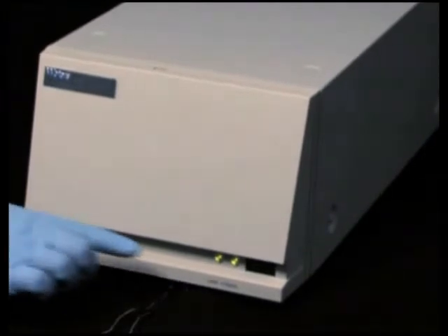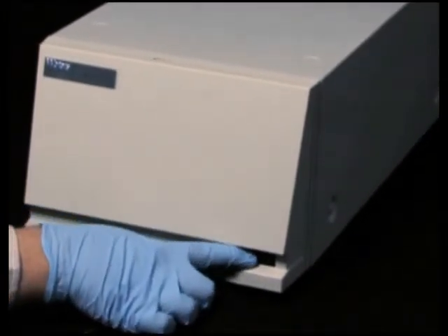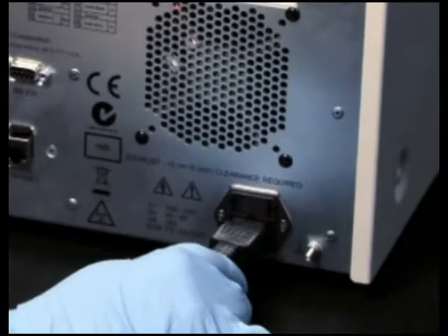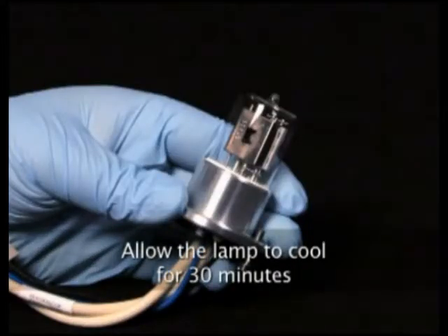Take the following precautions when replacing a lamp. To avoid electrical hazards and exposure to ultraviolet radiation, turn the detector off, disconnect the power cord, and allow the lamp to cool 30 minutes before handling it.